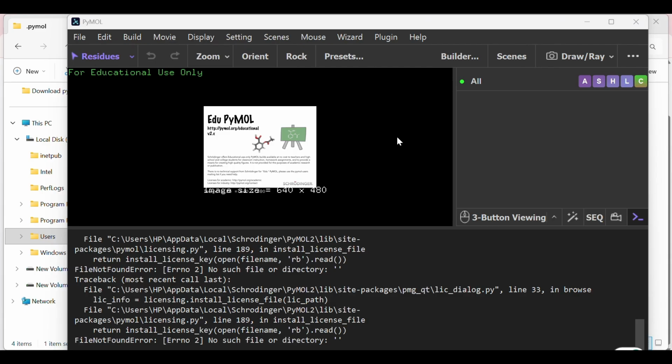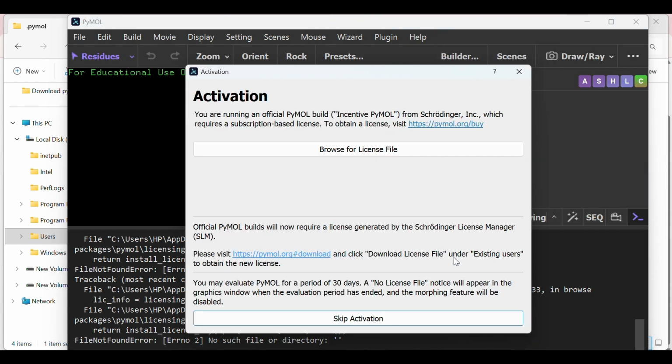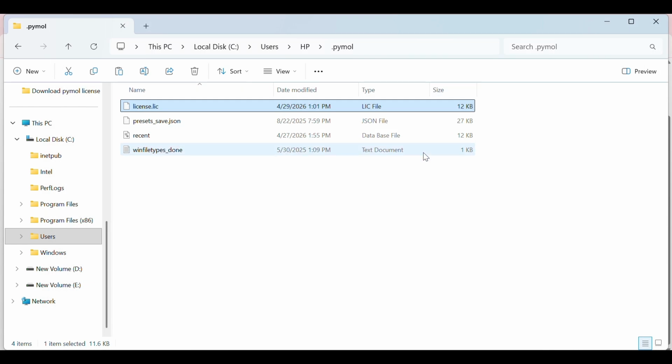If the activation tab didn't appear while you open the software, then simply click on the Help tab and click on Install New License File. The activation tab is here. You just click on the option Browse for License File, Upload, and it simply upgrades the PyMOL software for educational purposes. Moreover, there is another way to activate the PyMOL.